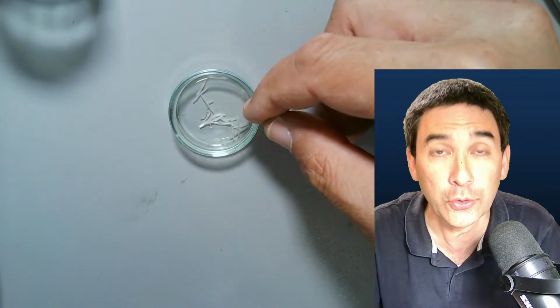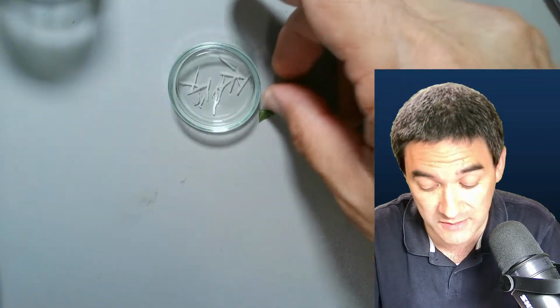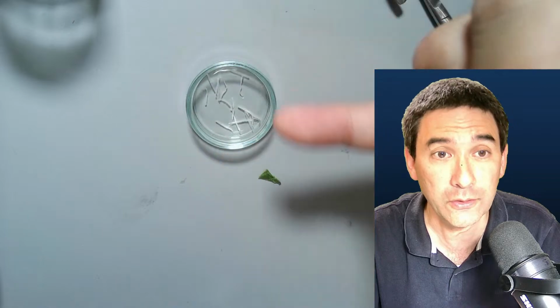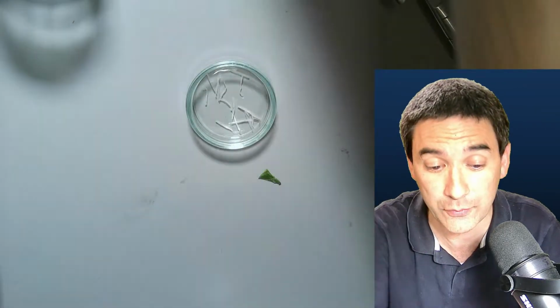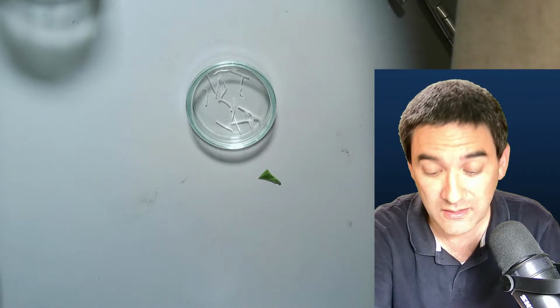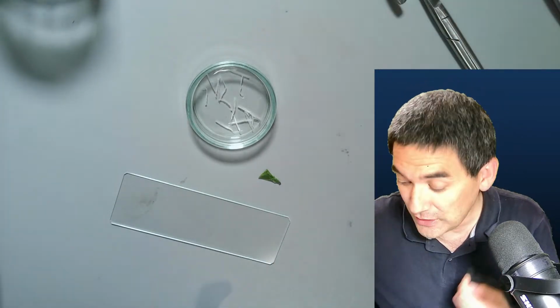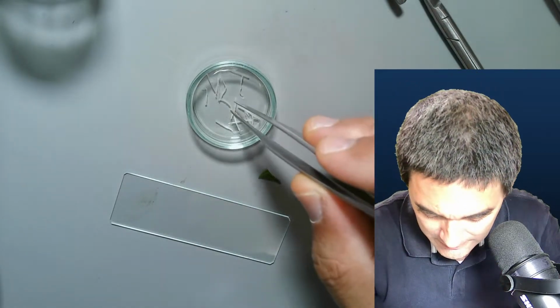The alcohol turned green, and then I kind of replaced the alcohol. And then after a couple of minutes, maybe 10 or 15 minutes or so, they lost all of their color and they turned white. And I would like to show you now those under the microscope. So this is pure alcohol. Pure alcohol has the disadvantage that the specimen starts to shrink, and deform a little bit.